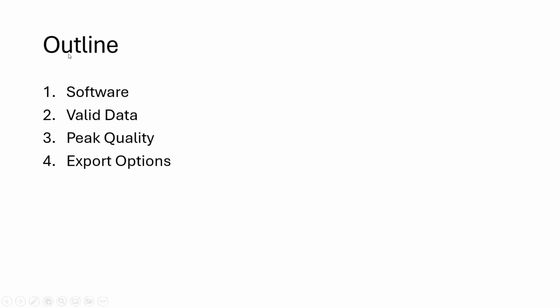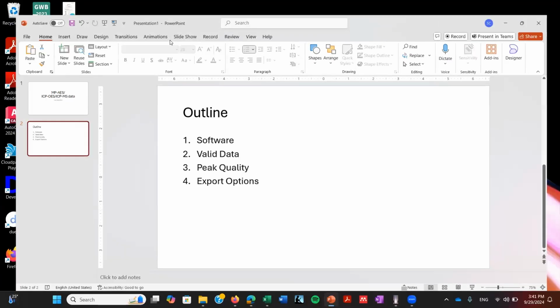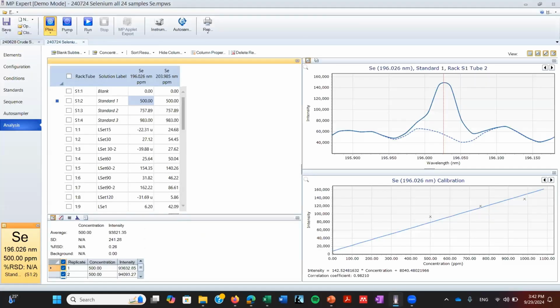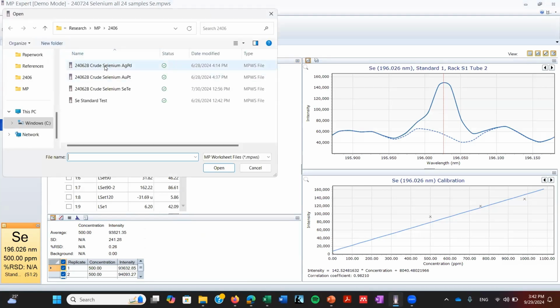So let us start with the software. The software that we're using is from the manufacturer Agilent. So we double click here, and we're going to open the software. I already did this before because this is going to take a couple of minutes to open. And whenever you open, you can select a file you want.